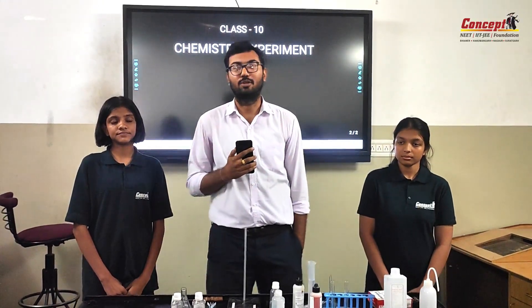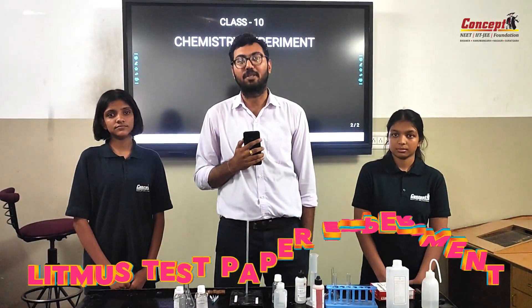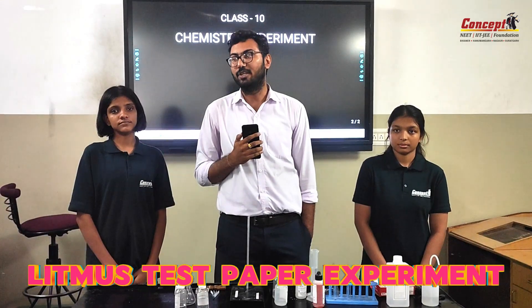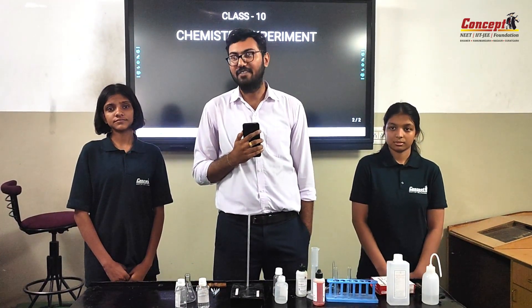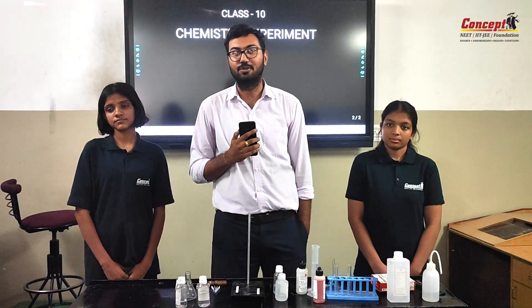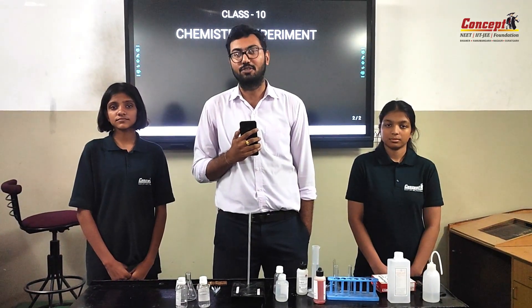Hello friends, myself Vakshaswamy. Today I'm with class 10 students who are going to perform a litmus test paper experiment. If I add acid into a blue litmus paper it changes color, and if I add base into a red litmus paper it changes color. We are going to see that.